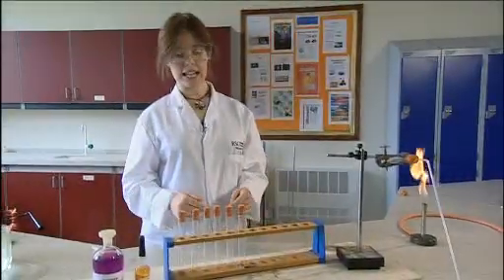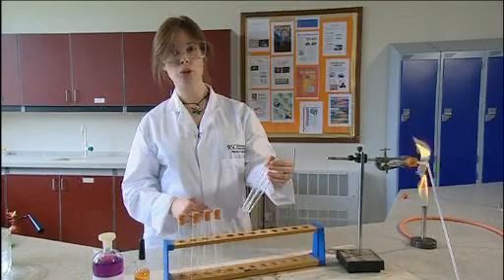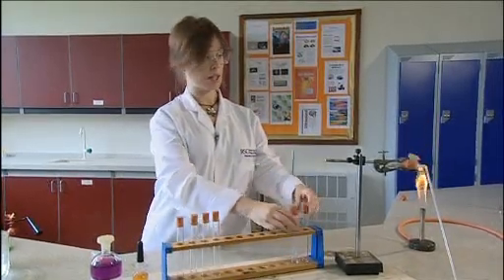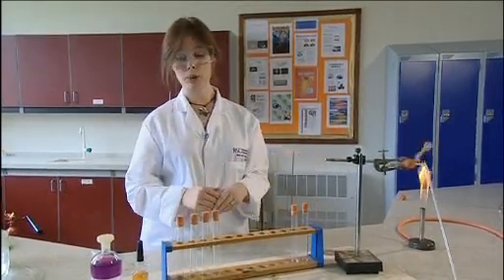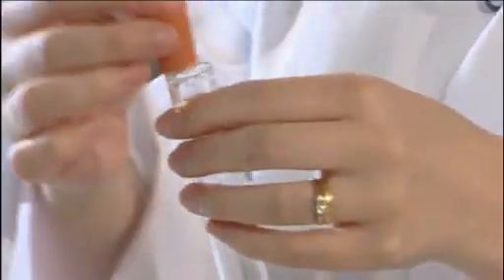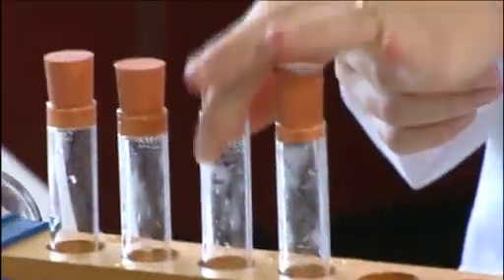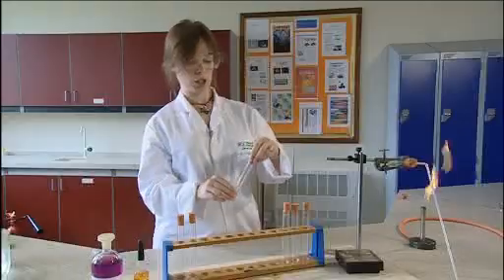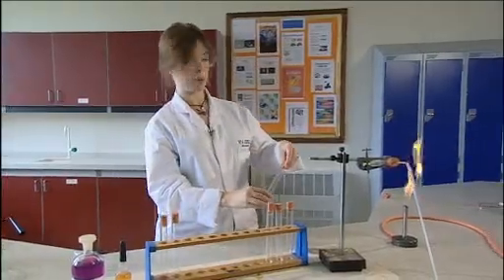Then you need to test the gases. The first two you can discard because they will just be air from your boiling tube. The third one you can pass around the class and they can have a gentle smell and it should smell something like camping gas which is a mixture of propane and butane. The fourth one you can attempt to ignite to prove that you have made a flammable gas.